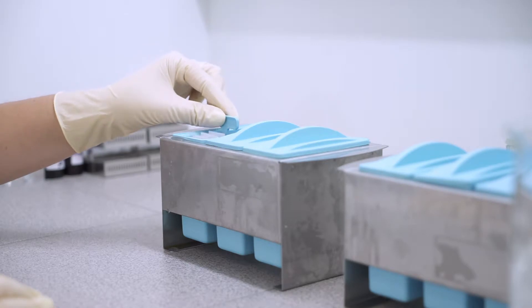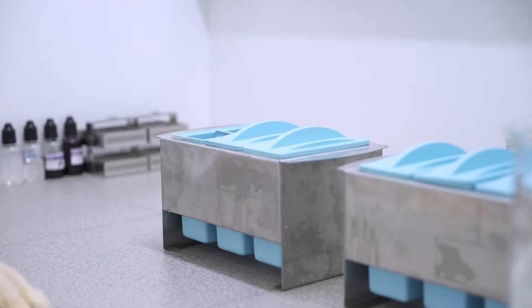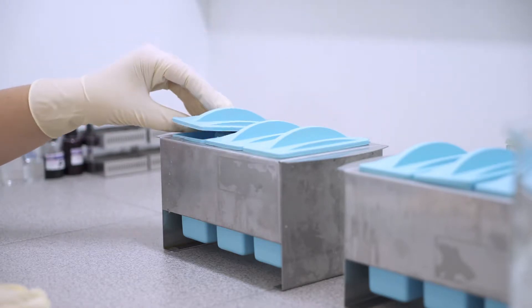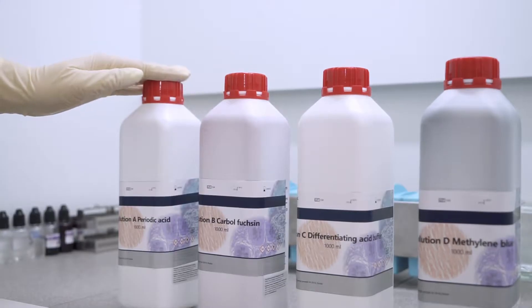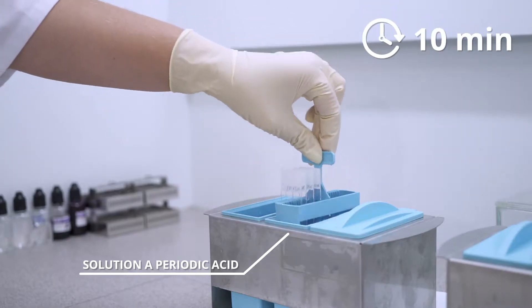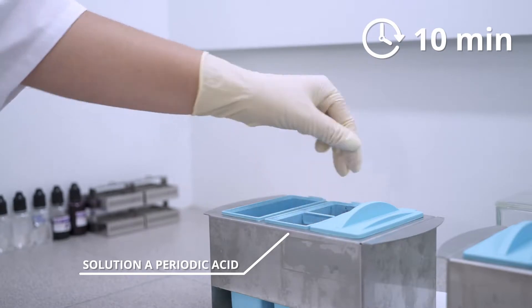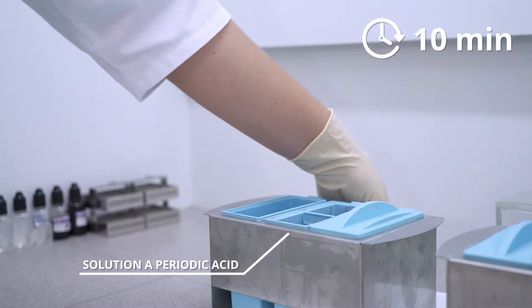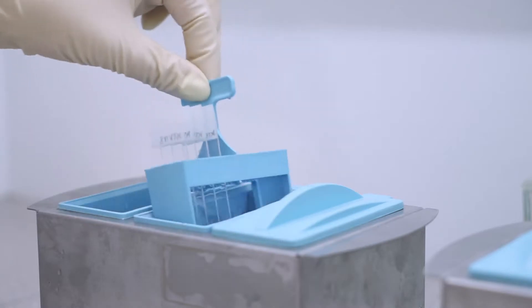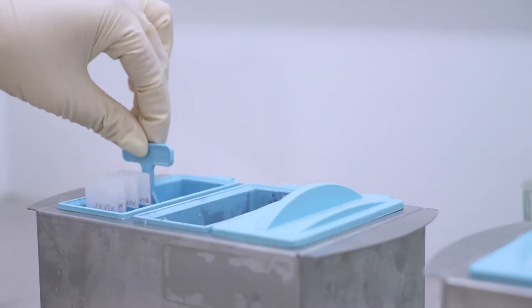First, slides after deparaffinization and rehydration are put in distilled water. Then we put slides in reagent A for 10 minutes. After that we have to wash slides in distilled water.